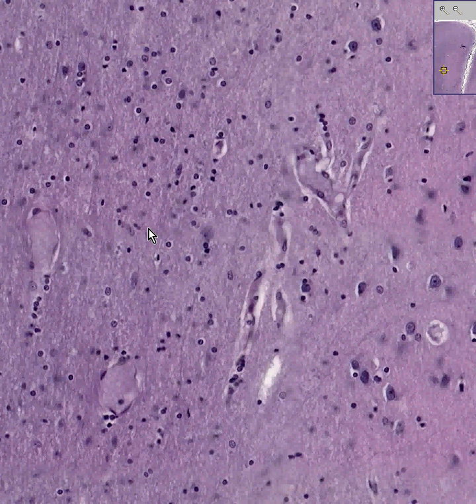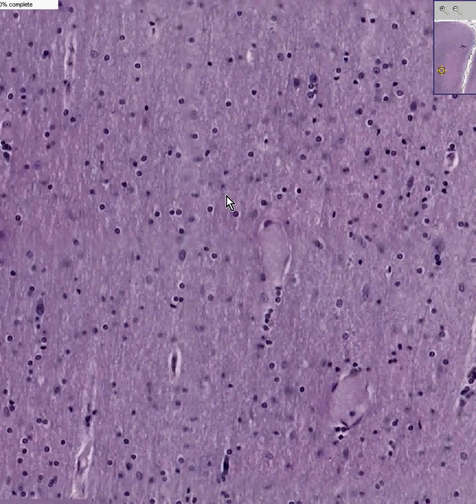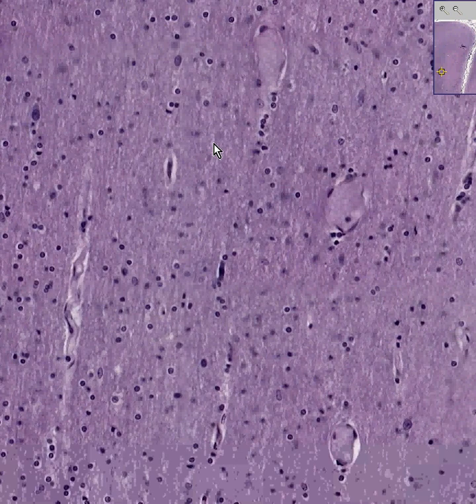Okay, now the difficult cells, which are very small, and they may have, if you cut them a certain way, a very tiny looking nucleus, perhaps more cigar shaped. These are called microglia, and they can be hard in routine stains to identify for sure. But whenever you see something that is extremely tiny and often looking extremely fusiform, if you happen to cut it along this long axis, like perhaps here, or here, or here. These are microglia. This is the third type of glial cells found in all portions of the central nervous system, and they function in being the macrophage-like cells of the central nervous system.